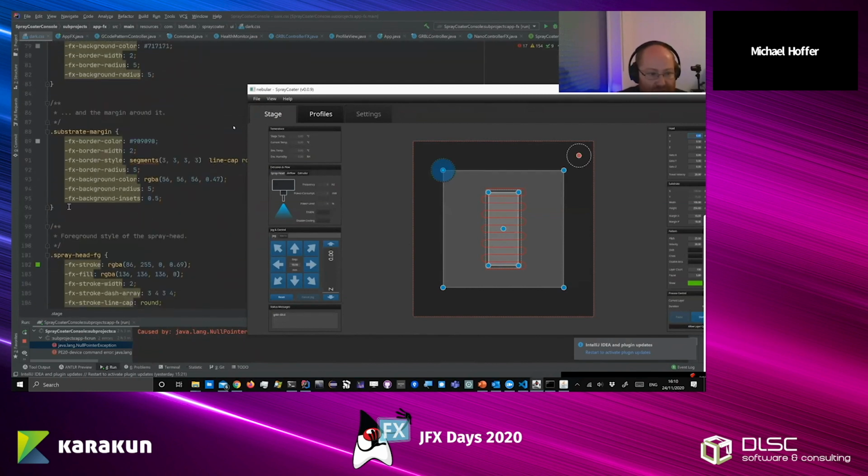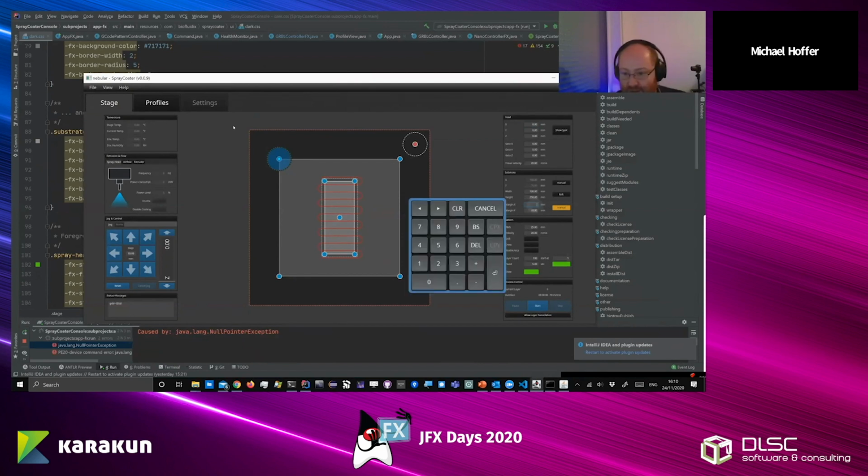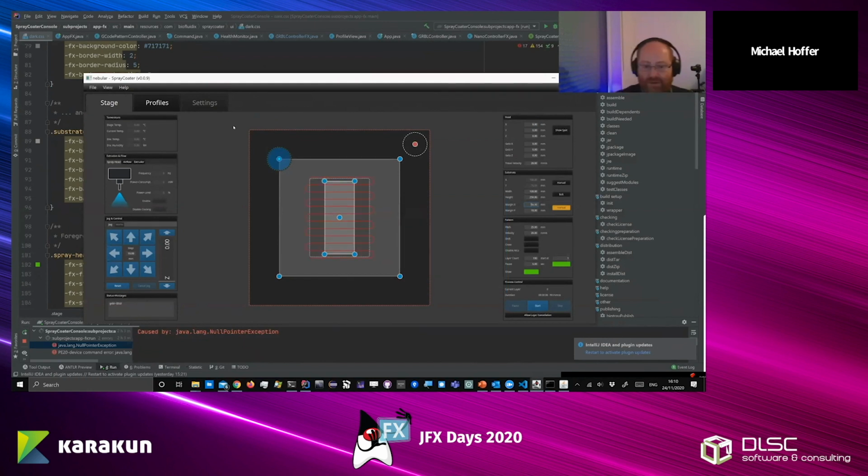And the substrate margin around it, this is like this darker gray rectangle. So let me increase that a little bit for the x-axis. This is the margin. Also pretty simple.